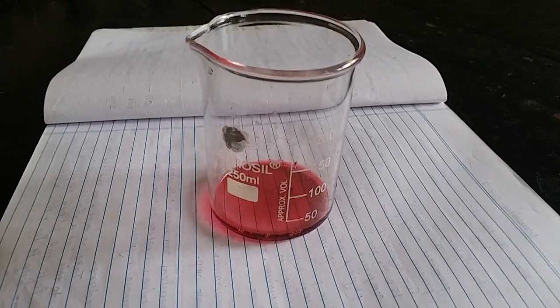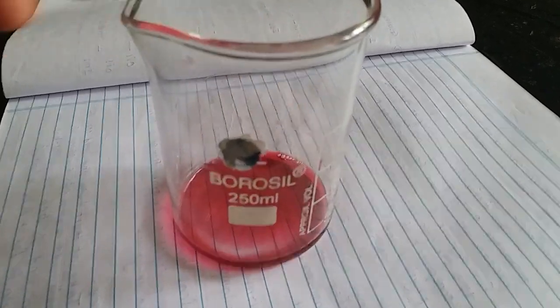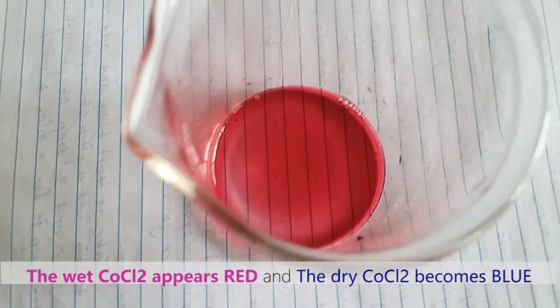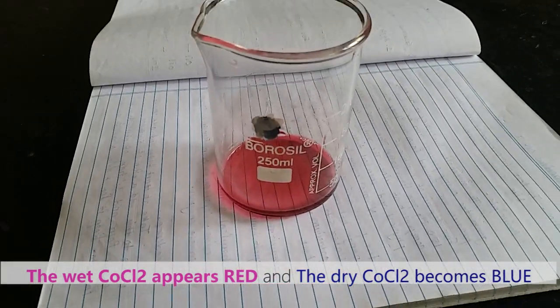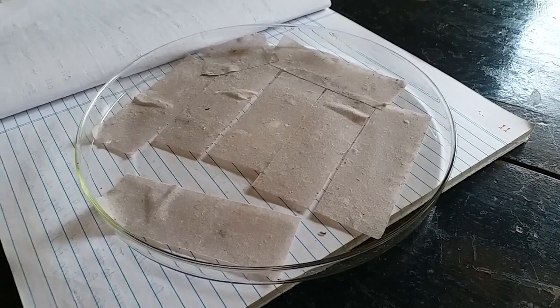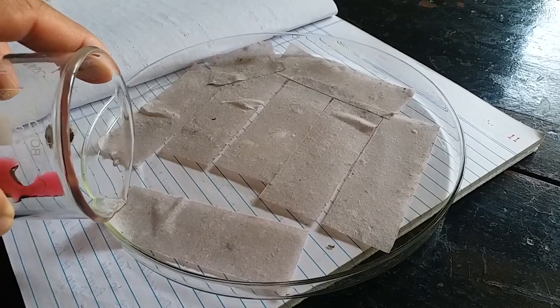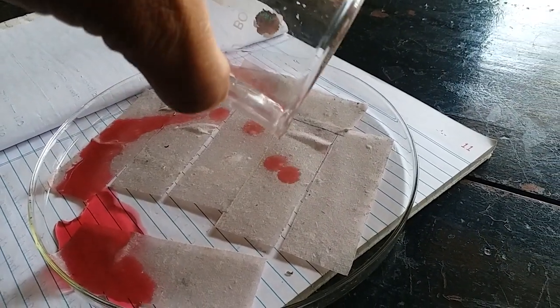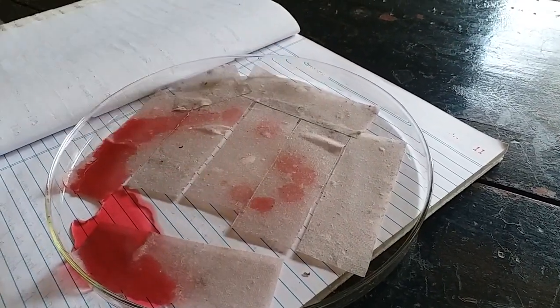We have prepared the cobalt chloride solution. One can see the color of the cobalt chloride — it is red because we have added it in water. When it is dried, it will turn blue in color. We will soak this blotting paper in the cobalt chloride solution, and after drying, these papers will be used for detecting the rate of transpiration.